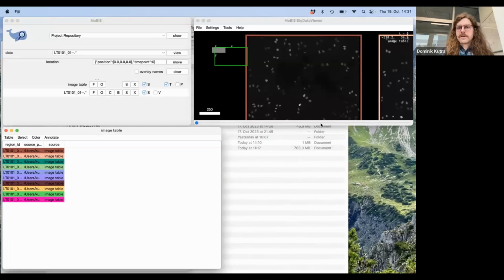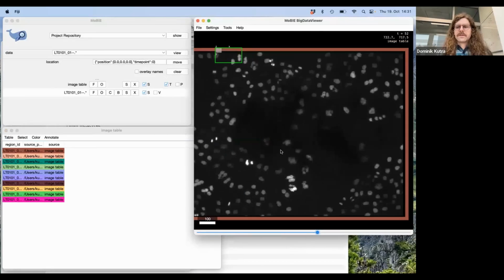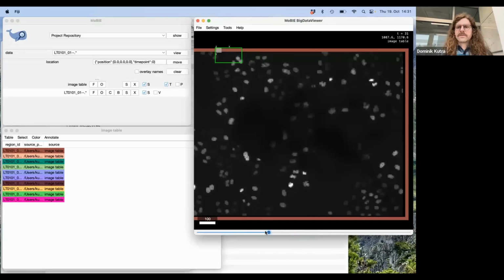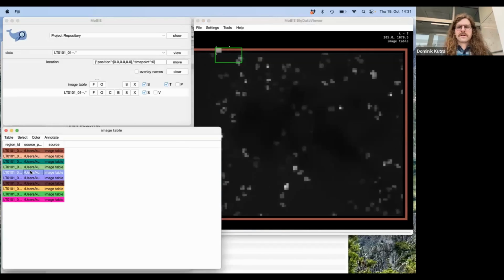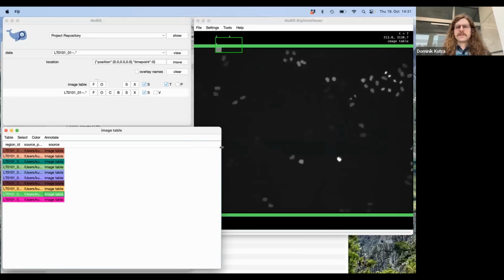Yeah, and maybe if I make the viewer a little bit bigger, oops, I can also show you the data. So these are time series. You can see you can scroll through them. You can go to the different data sets. Like everything Tischer mentioned before still holds.